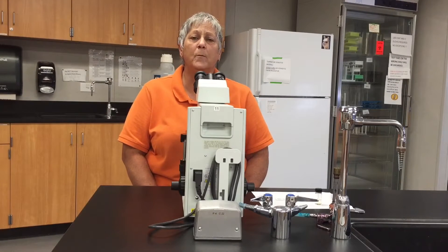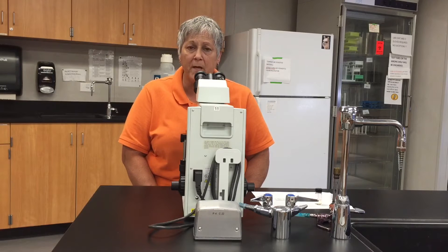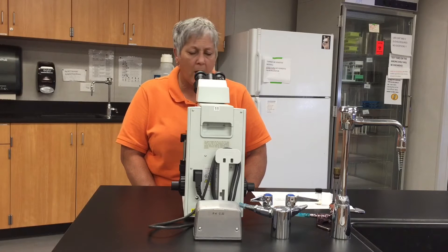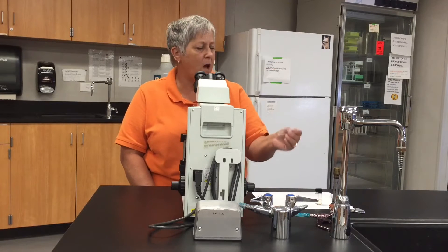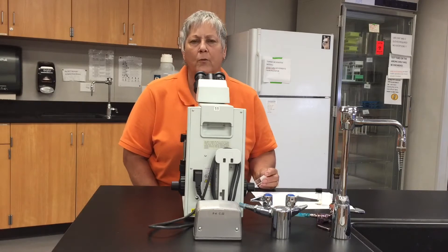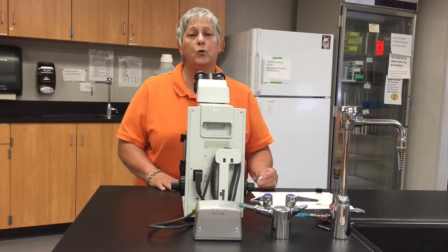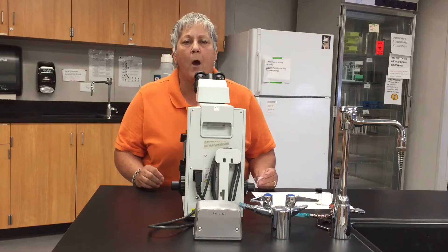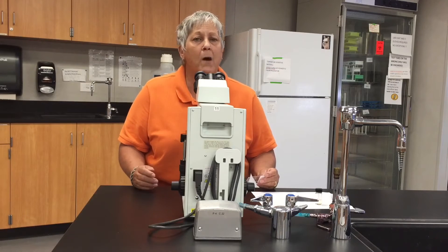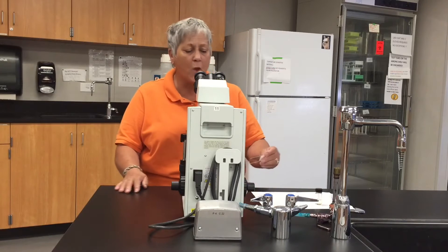Hi students, this is Professor Schimald and I want to talk to you today about how to find a specimen and bring it under focus with your microscope. I've got a microscope slide here — it is a bacteria 3 morphologies slide — and we're going to begin with the low power lens. We're really not going to use the scanning lens much, if at all, this semester, so just forget the scanning lens and start with low power.